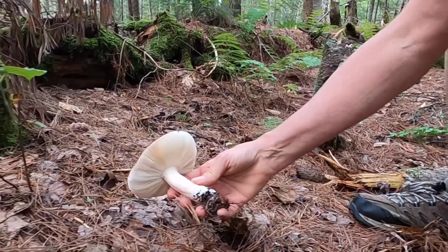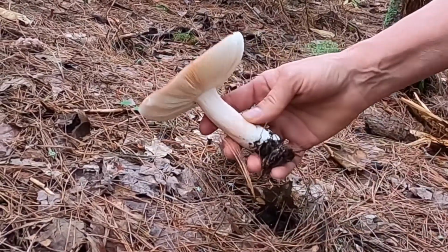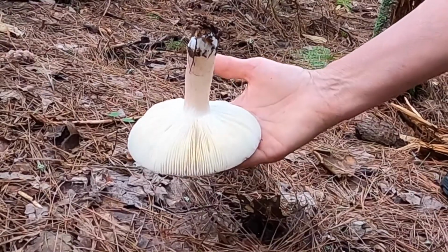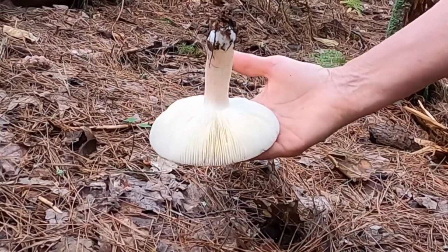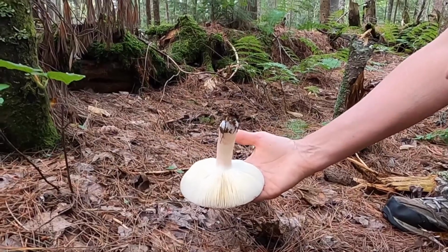You can see the stalk, obviously, and then the top of the fungus, and this one is pretty flat. But here, look at these beautiful gills. So in lab, we have a prepared slide that allows you to actually see a cross-section of a single gill, and that's where you would be able to see the club-shaped structure that is producing the spores.